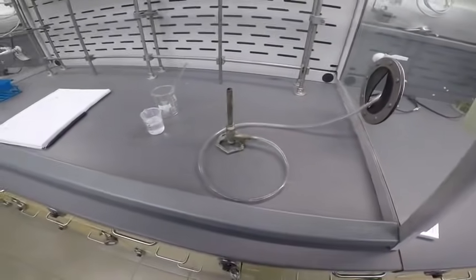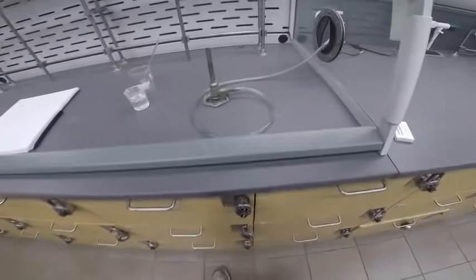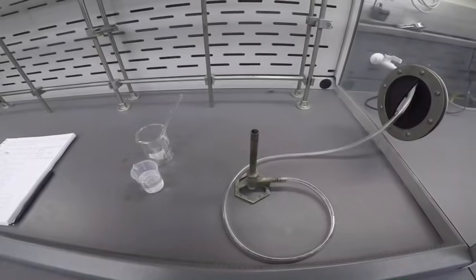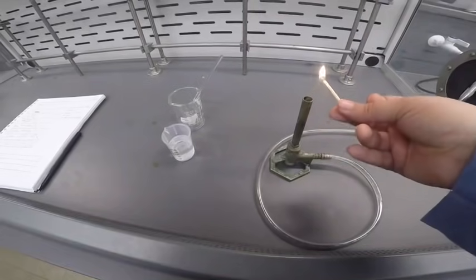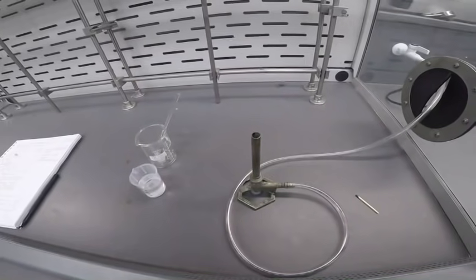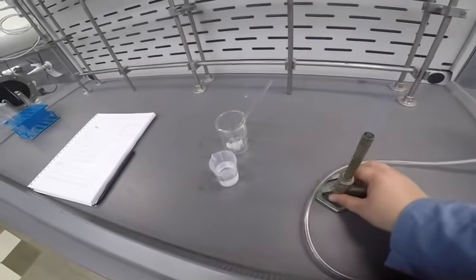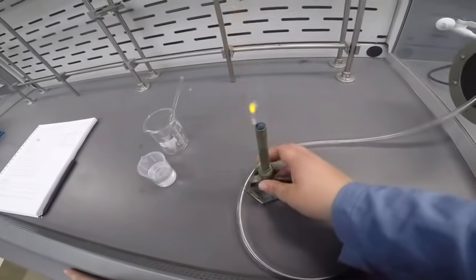I'm actually going to take this pair of gloves off for my flame test. Me and the gloves during heating are not friends. I get a little scared. All right. Gas is on. Oh, okay. Guess I didn't turn that on high enough. All right, let's adjust our flame. And we've got best flame practices here.